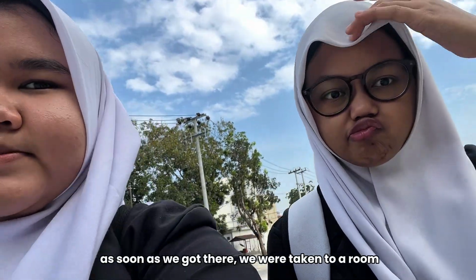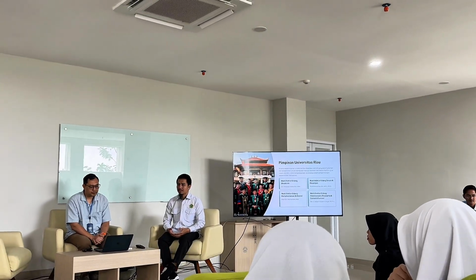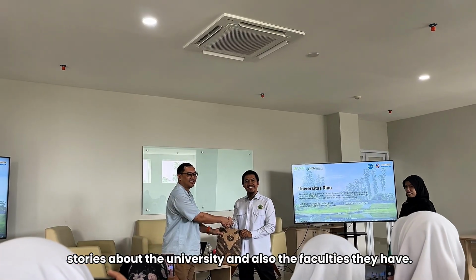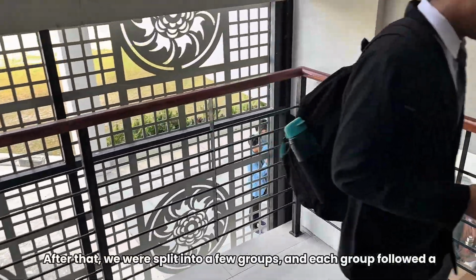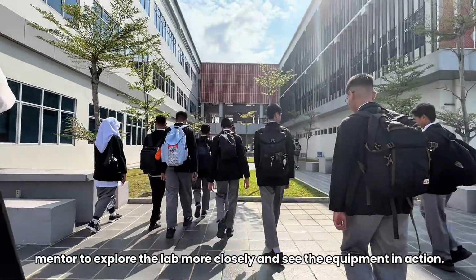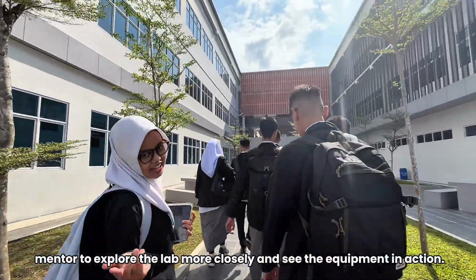As soon as we got there, we were taken to a room for a quick introduction about the lab. They explained about the laboratories available, stories about the university, and also the faculties that they have. After that, we were split into a few groups, and each group followed a mentor to explore the lab more closely and see the equipment in action.